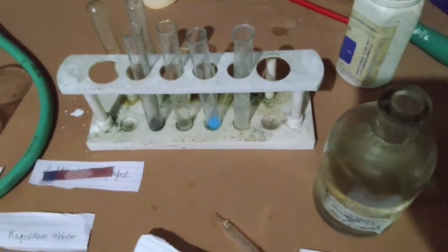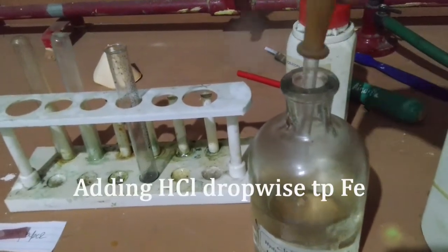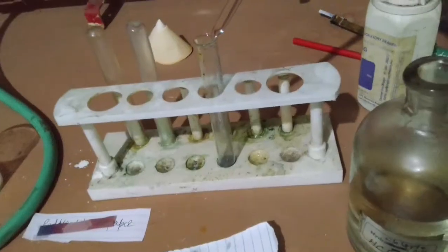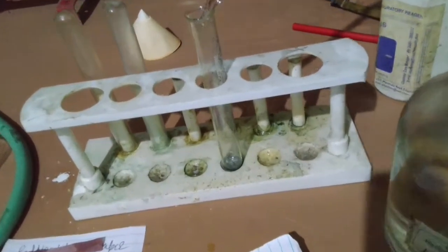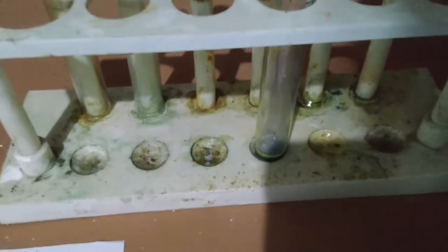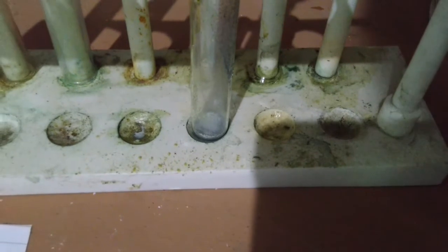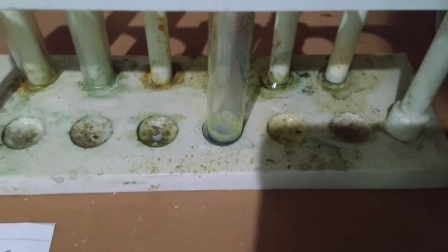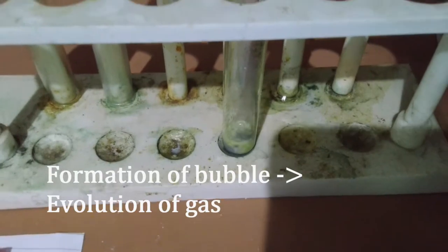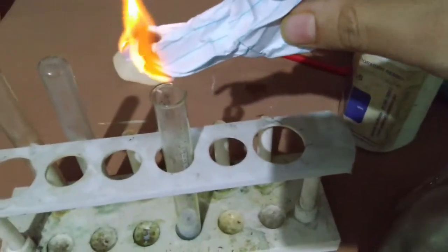Don't handle the acid with bare hands. So let's see. Can you hear?